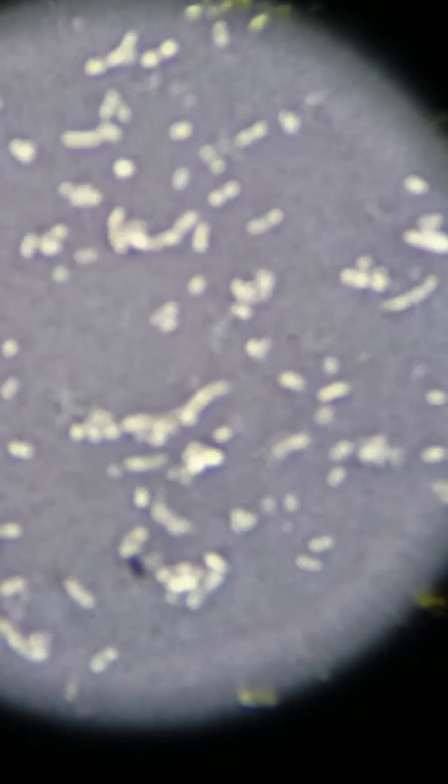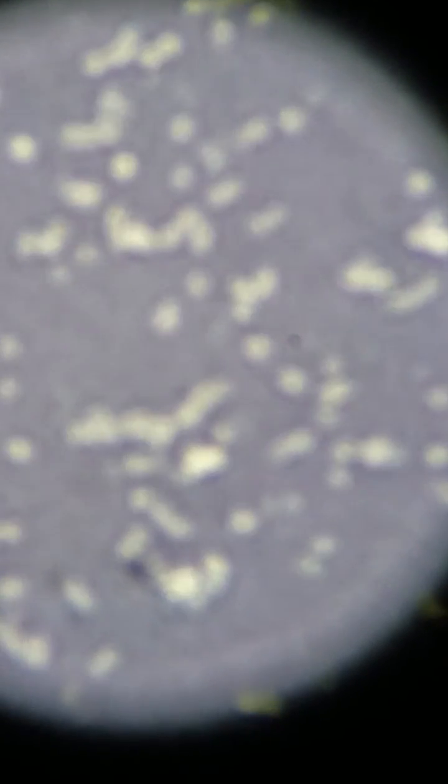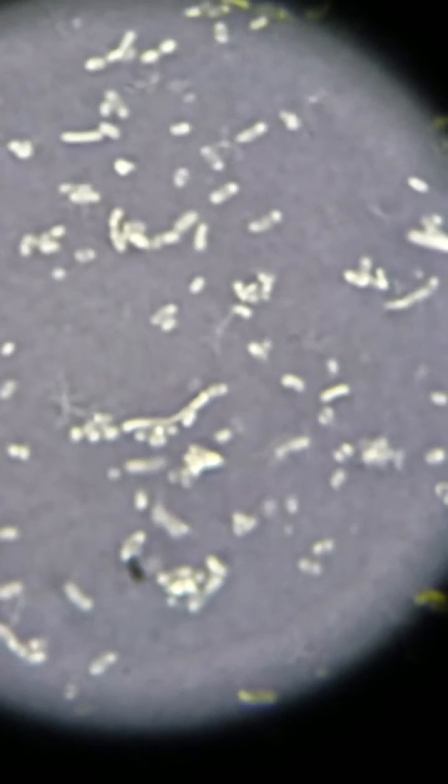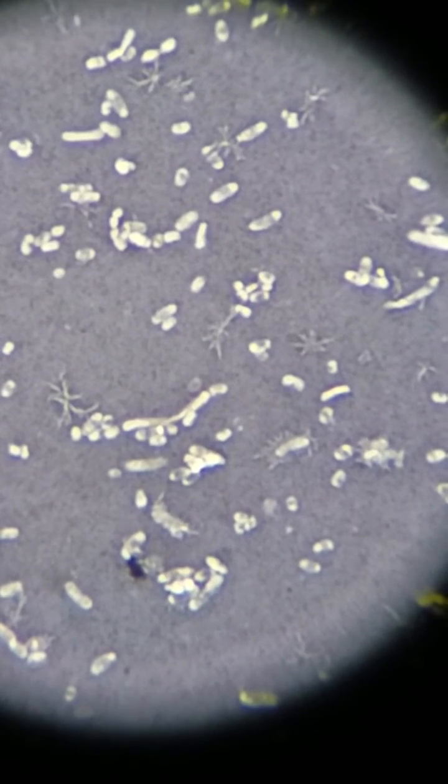But if I was to take it to the immersion oil, so put it on here just like this, and then you can see that the images of the organisms and some of the inclusions that are in them, you can see them quite nicely.